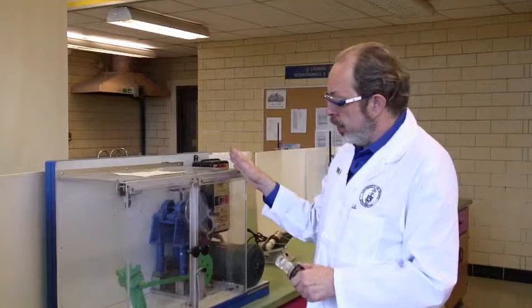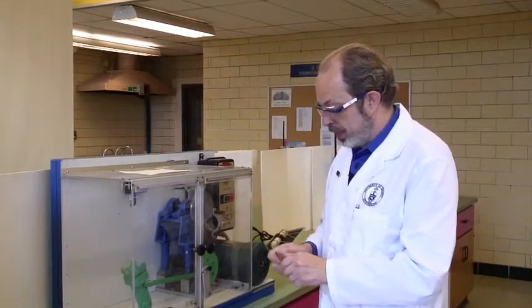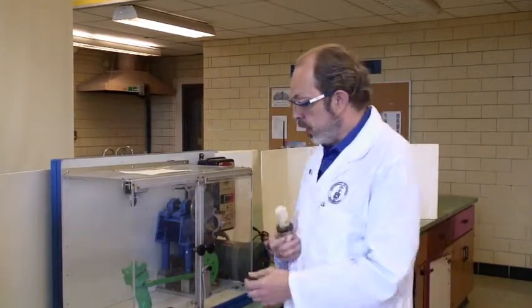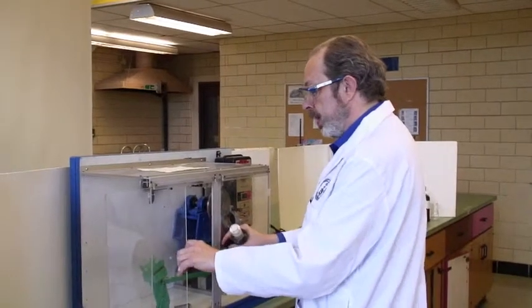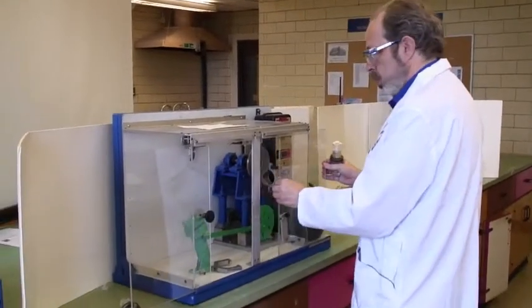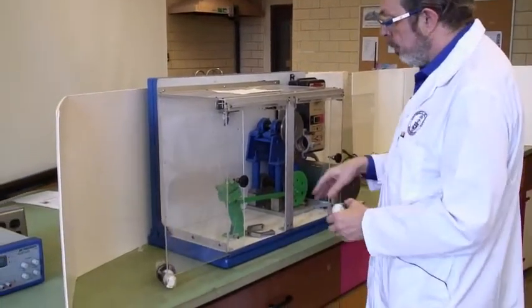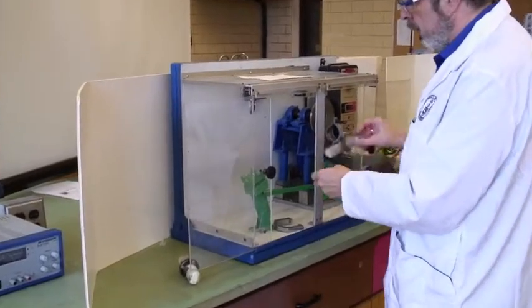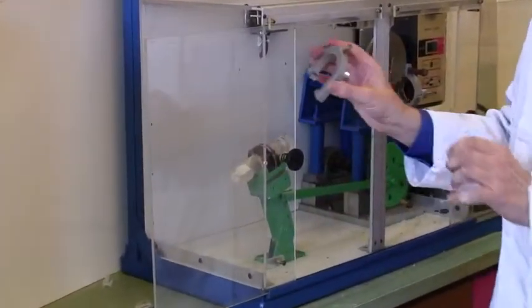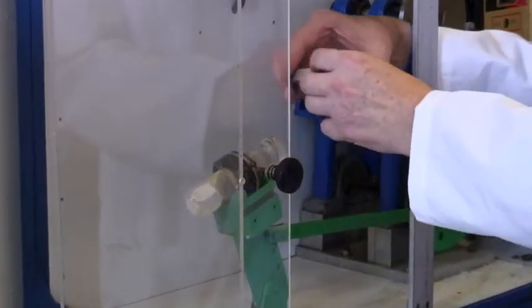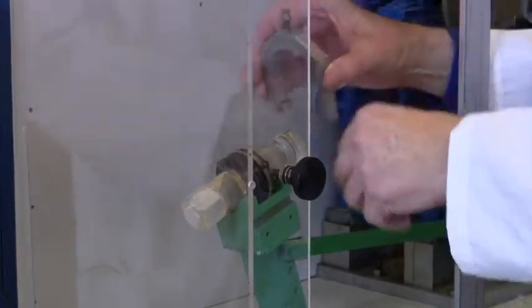This instrument here is a rocker and an agitator. And once you've got your cells ready, there are two different kinds of movement available here. This one is actually a rocking arrangement. The cell sits right there, and there's a horseshoe-shaped arrangement with a thumb screw here.